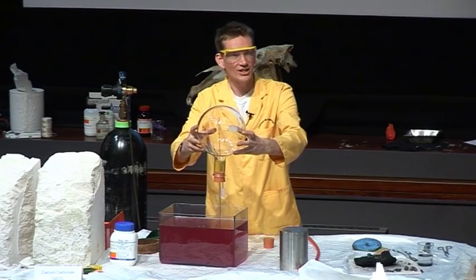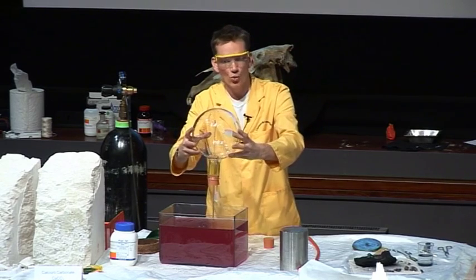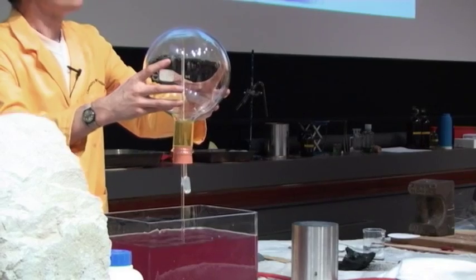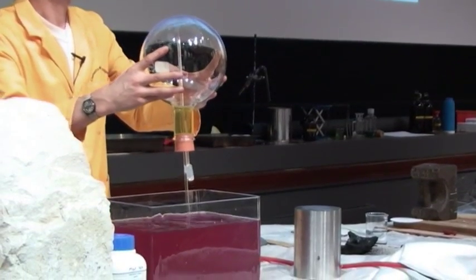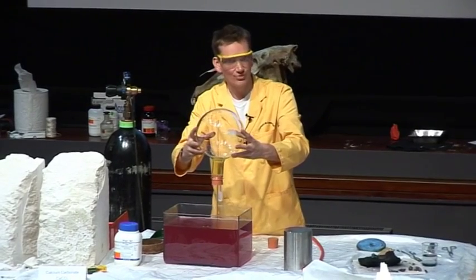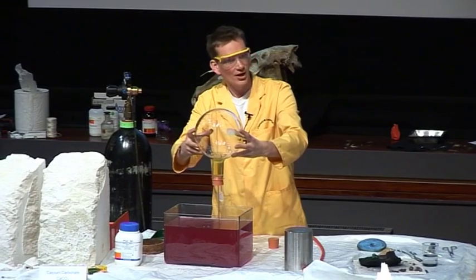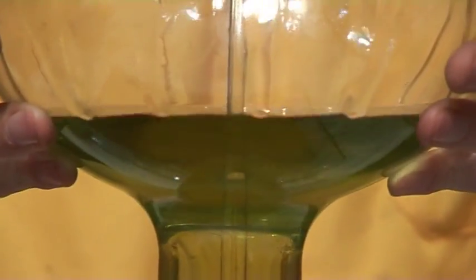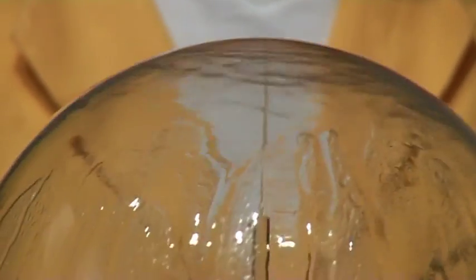So you can see the water gradually filling up, and this is just because the ammonia is so soluble in water. We've also added some colouration to the water here. This is actually from a red cabbage — the red colour is just due to some red cabbage that we boiled up in some water, and you can see that the colour is changing here because the ammonia is very alkaline, and the cabbage colour is acting as an indicator and changing colour with the ammonia.